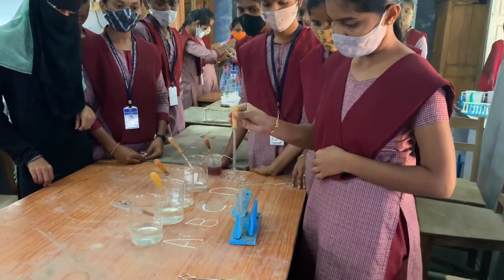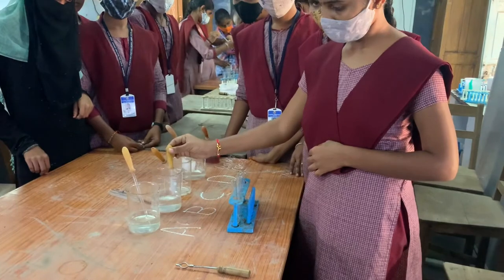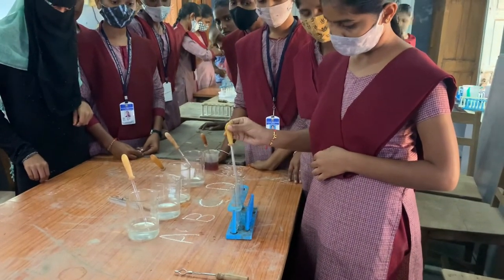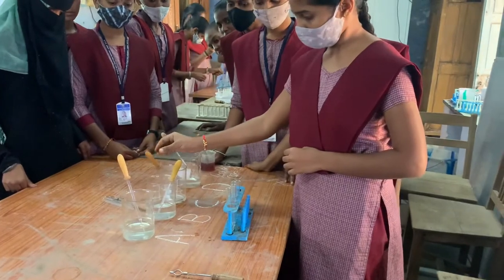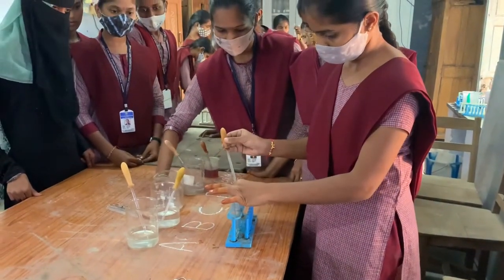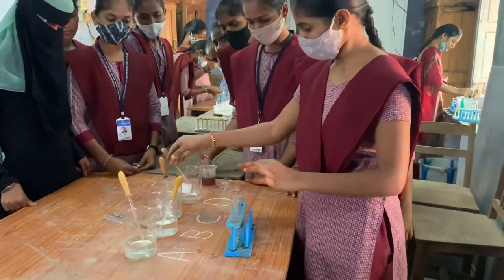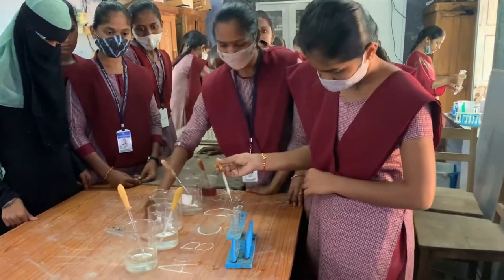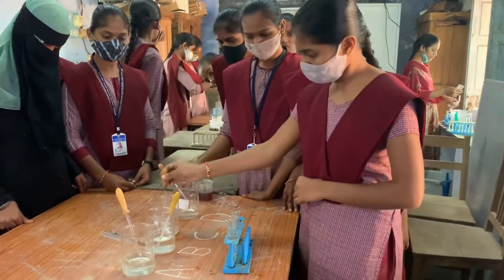Sample A goes into the first test tube, sample B into the second test tube, sample C into the third test tube, and sample D into the fourth test tube — approximately one ml of each sample.